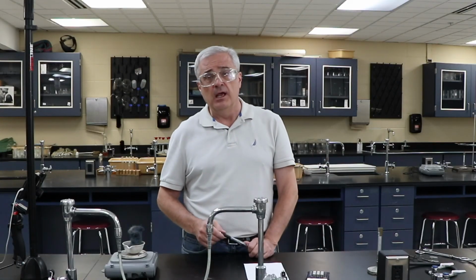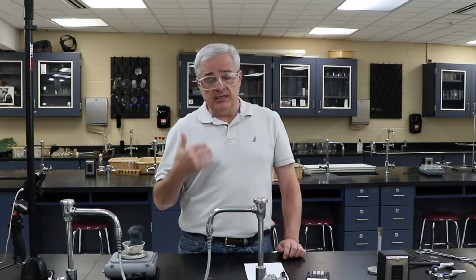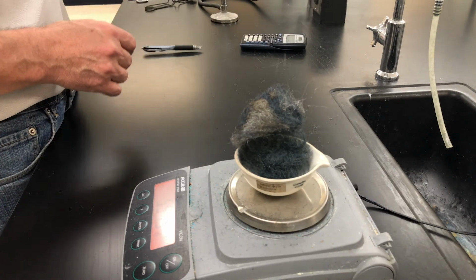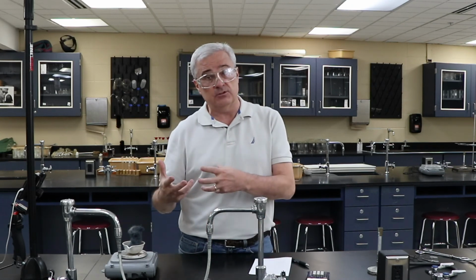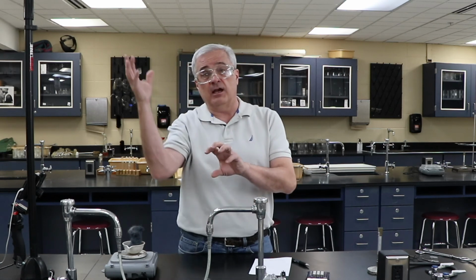Nothing profound here. I'm not going to do the stoichiometry because there are so many pieces of it that were inaccurate. What we can say from this is that the mass gain clearly came from somewhere. The only way to explain that mass gain is that in the chemical reaction, a new substance was formed, and that was formed from the iron and the oxygen in the atmosphere.